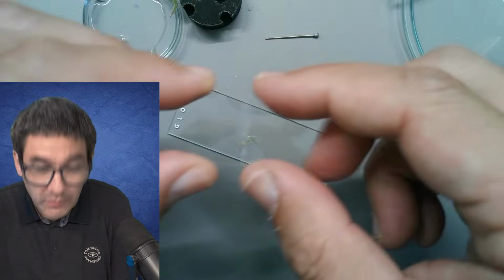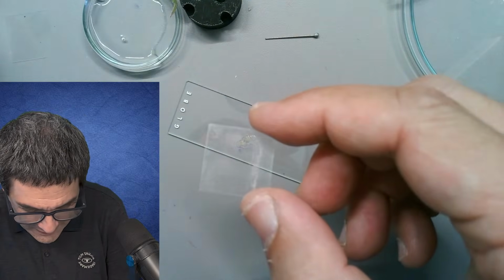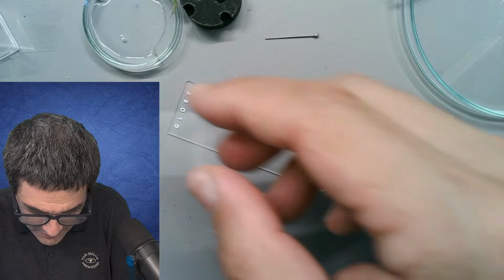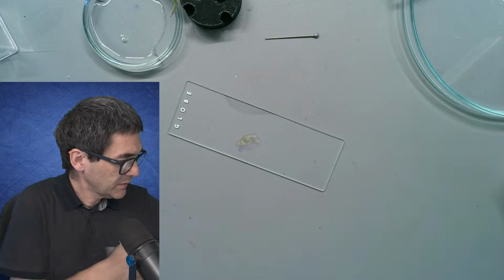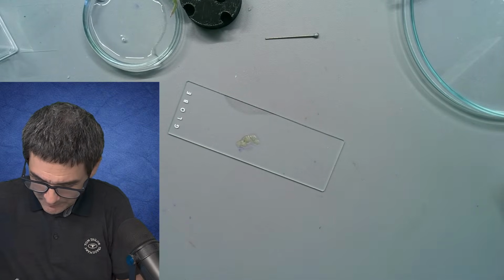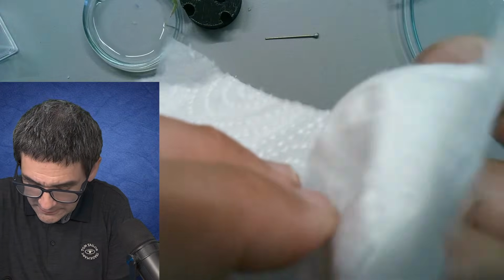Look at this here. Do you actually notice how dirty this one is? There's a reason for that, because I actually washed those cover glasses, but there is some deposit of calcium carbonate. Some water stains are still on here, so I'm going to quickly also wipe it, simply to make it a little bit cleaner.